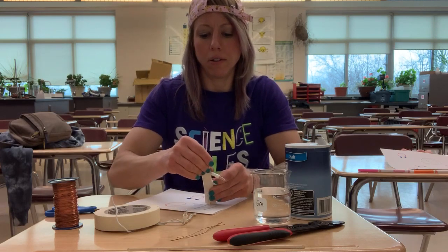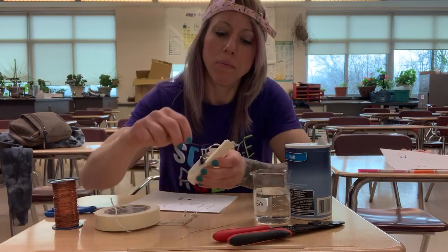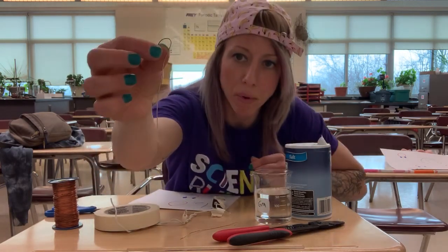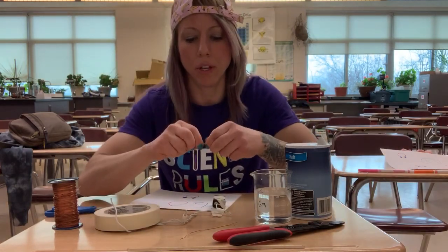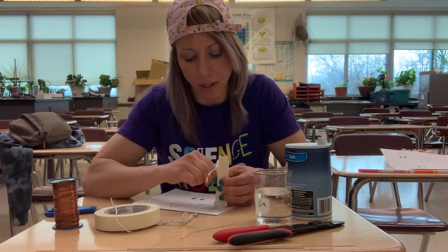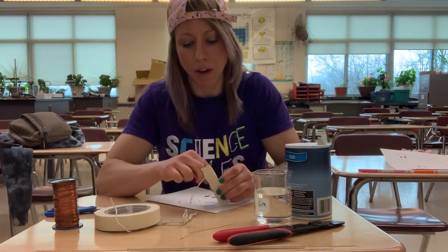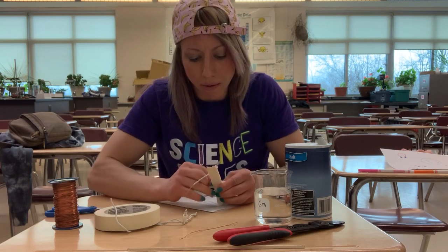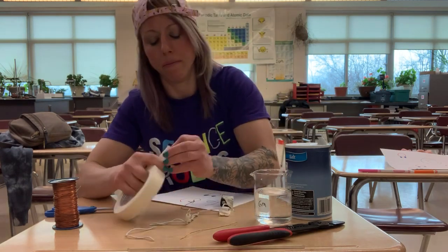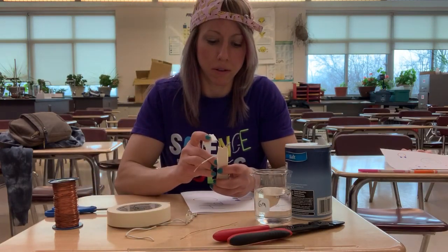And then from the other probe area of the 9-volt battery, I'm going to take a piece of copper wire. You could actually pull this from the Christmas strand as well, since you're sacrificing it for the greater good here. So I'm going to loop that around there and tape that in. Again, electrical tape works much better for this.